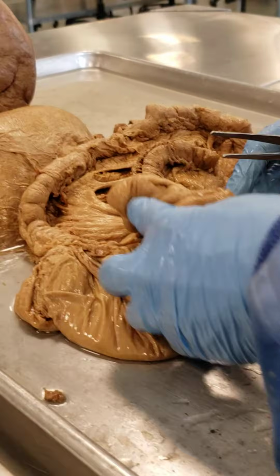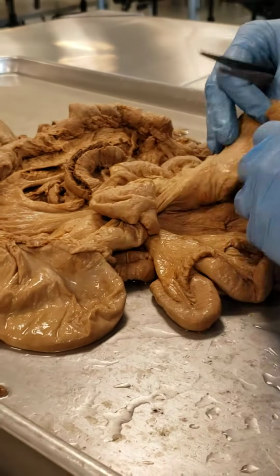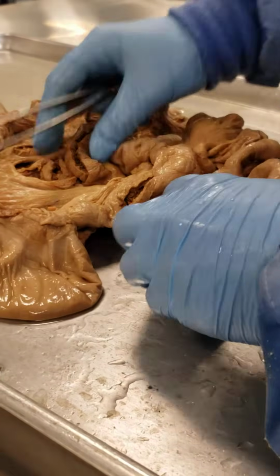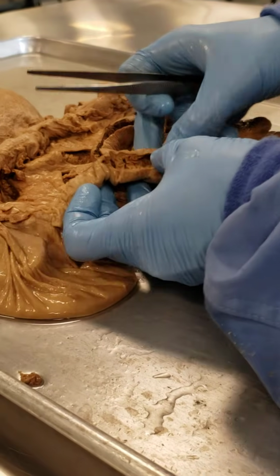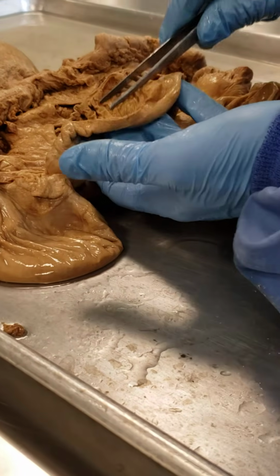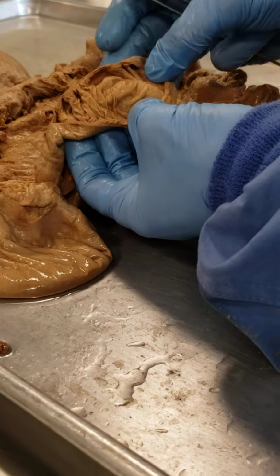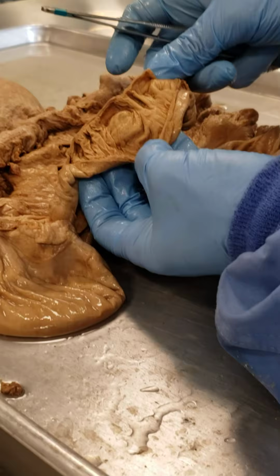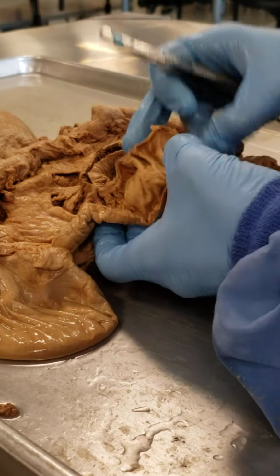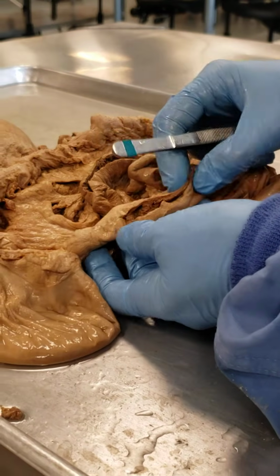Now, if we go to the distal end of the small intestine, I want to show you what the plicae circulares look like when we open up the ileum. So we had the jejunum and we have the ileum. And you can see where those raised ridges just are not as prominent further along in the digestive tract, okay? So the plicae circulares diminish in terms of their height as we travel through the digestive tract.